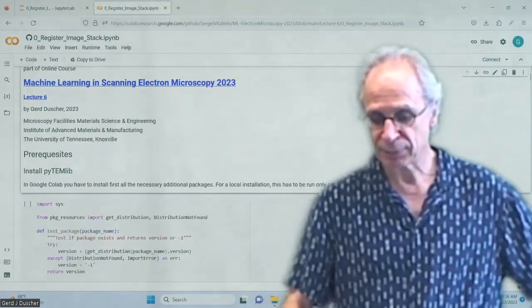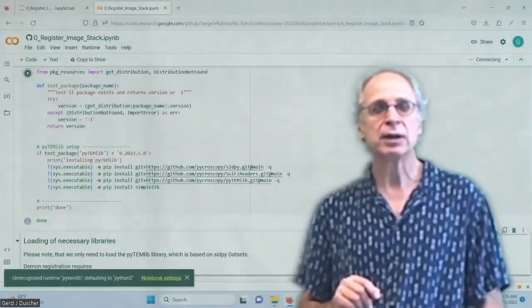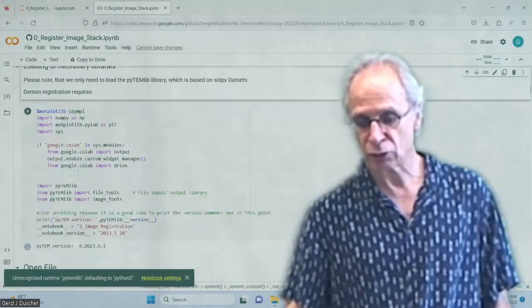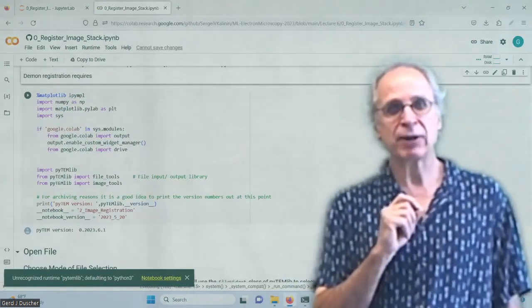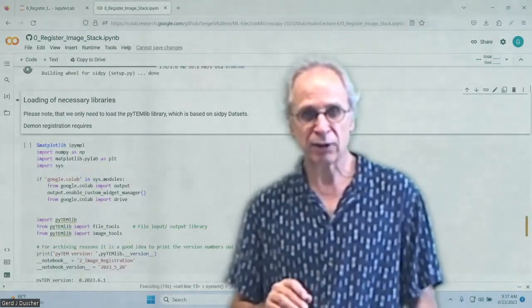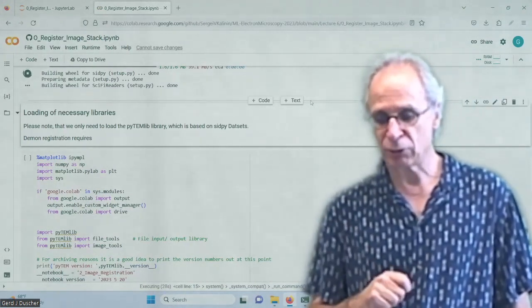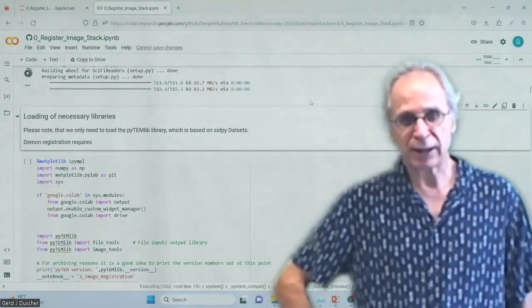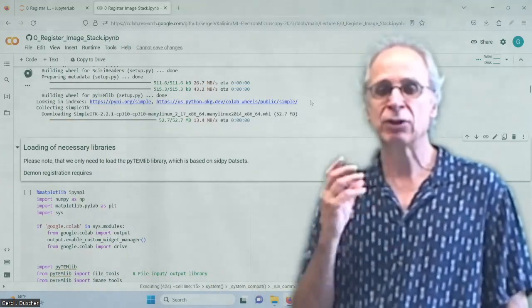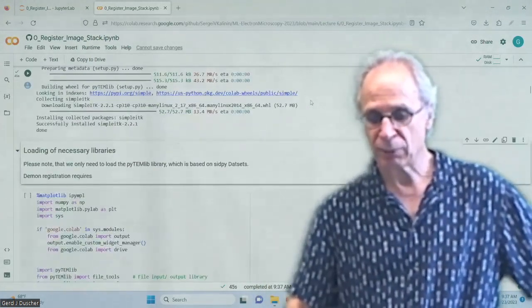then what you have to do is, as usual, load all the different packages. Not sure that's the newest one. Google Colab has one problem that we will see here in a second, and that is that it does not really allow the IPython widgets event manager getting full access to that. And that is why I'm going to show you the whole thing also on my own computer, so that we can see the effect of the widget registration. It's much nicer if you have that like a movie showing. Okay, so I installed it all.